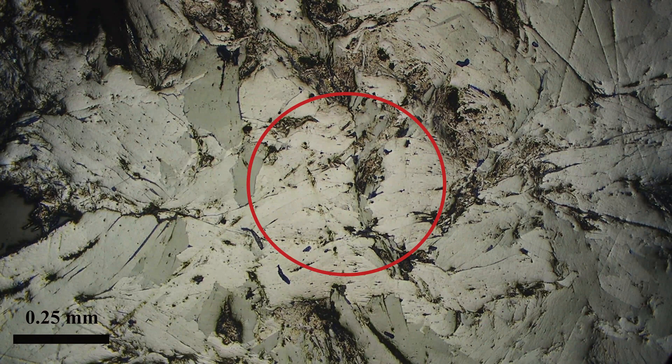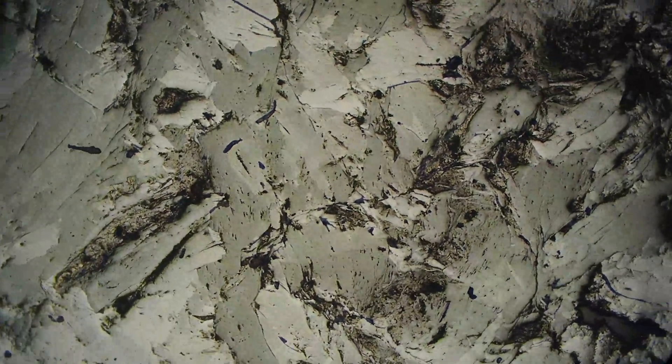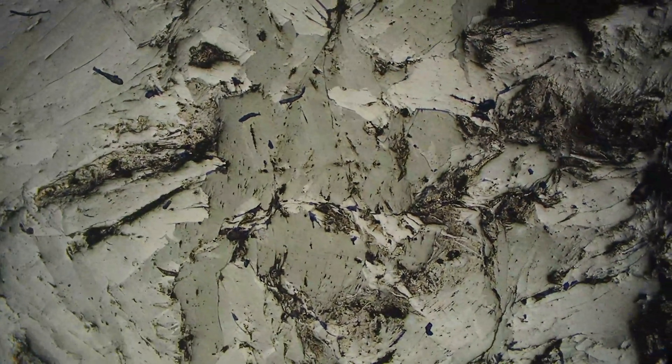Hi everyone, today we're going to learn how to identify molybdenite in the polished section. Here is some molybdenite and it's generally kind of this light gray to darker gray, and you can see that it'll transition from these white or light gray through darker gray.